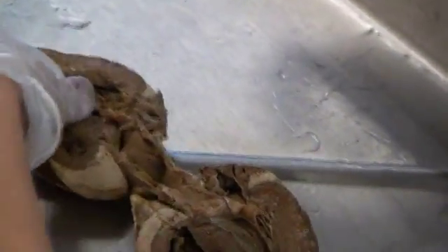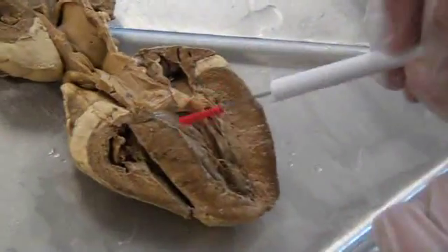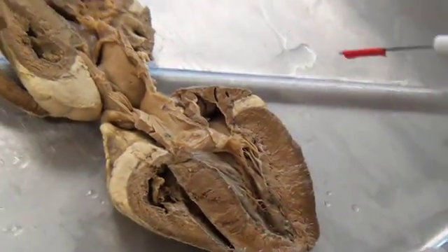And number thirteen, which is the interventricular septum, which is right there. Thank you.